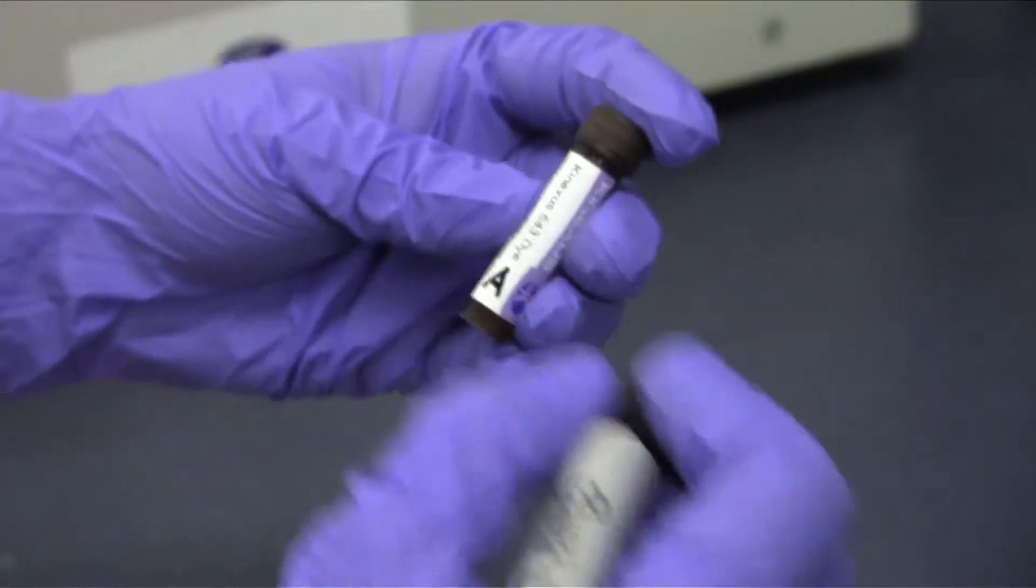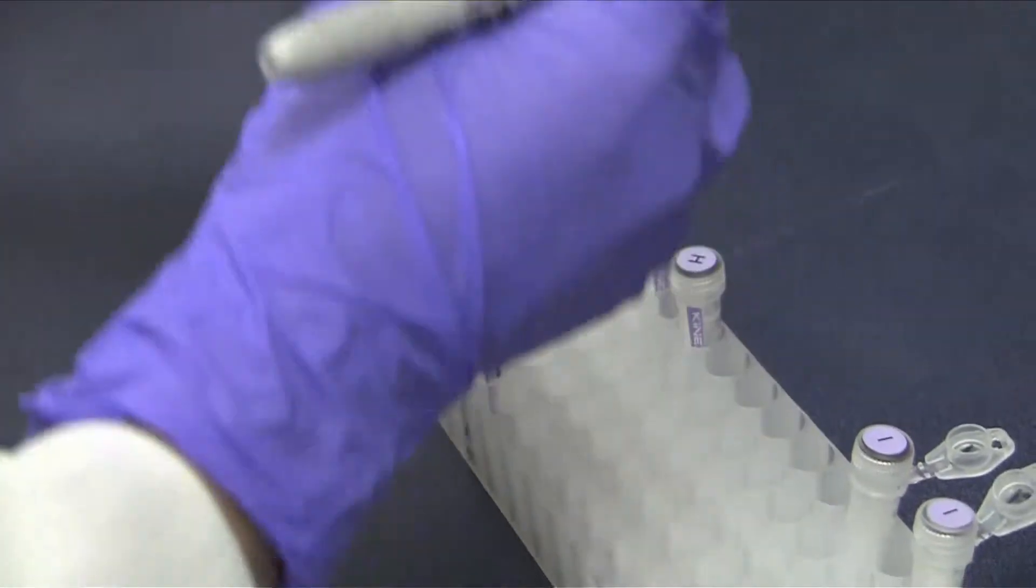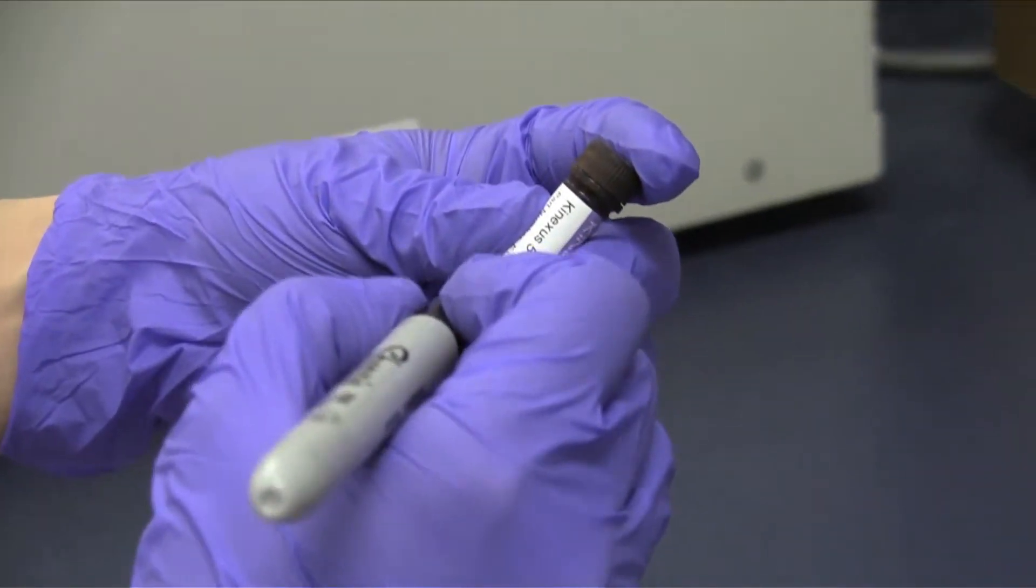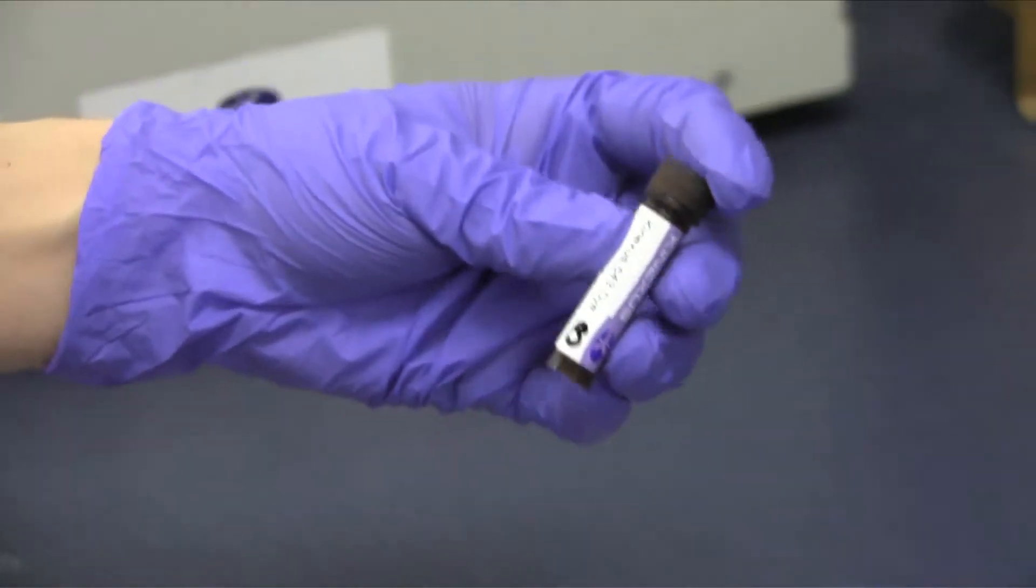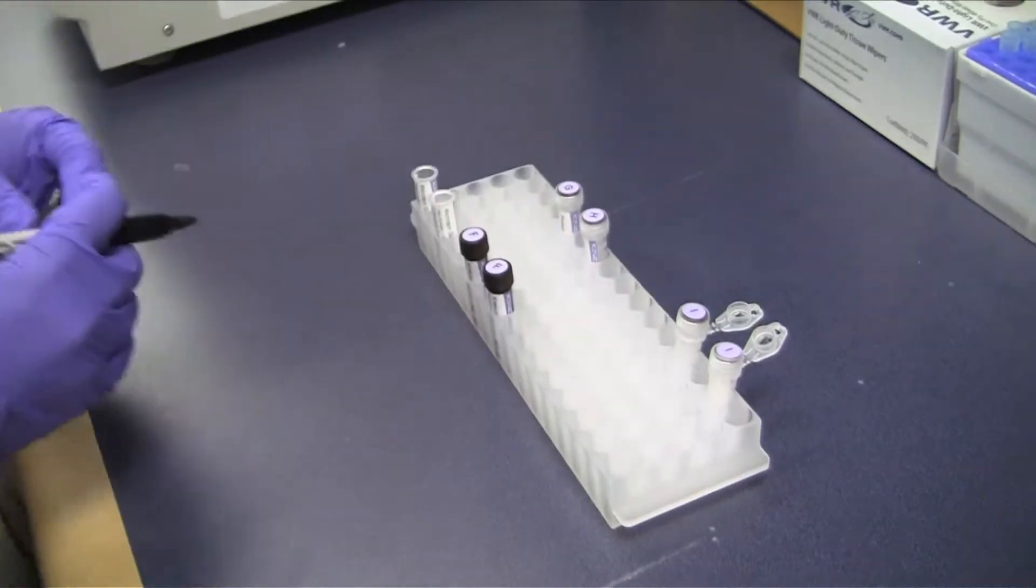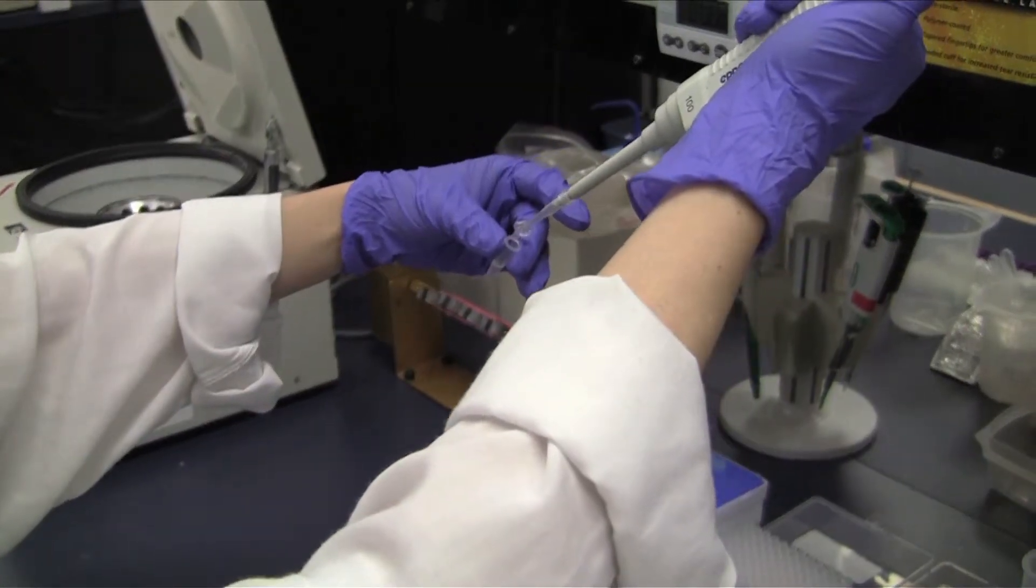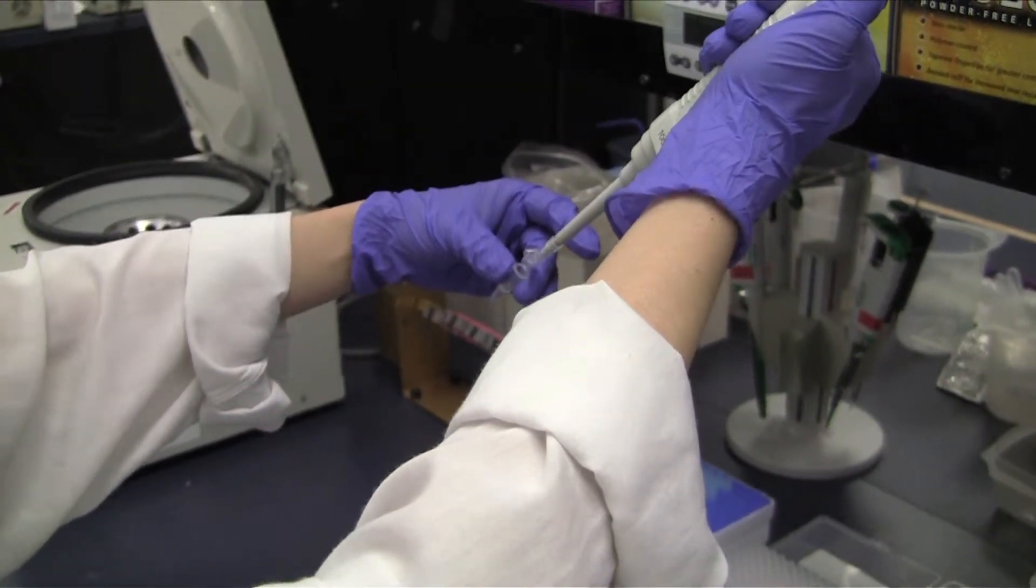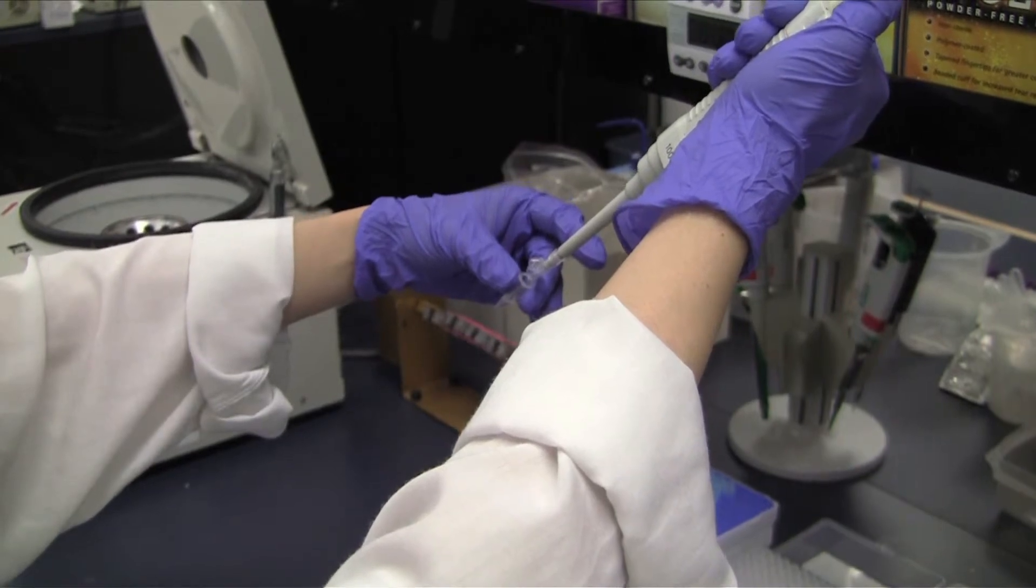Label the tubes containing Kinex labeling dye part CAMF with their respective sample IDs. Transfer 50 micrograms of each sample into the corresponding labeled tubes.